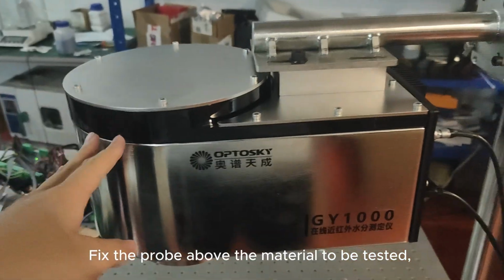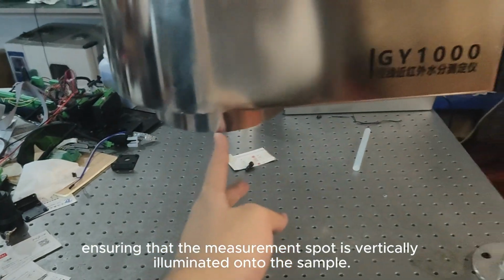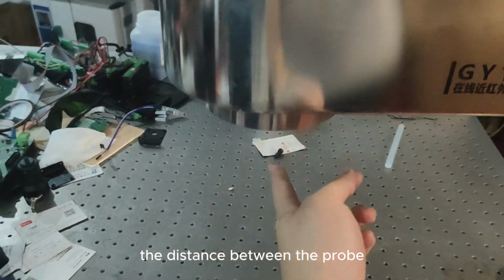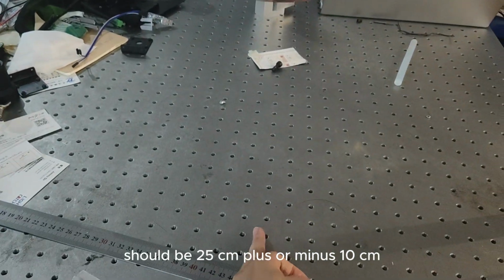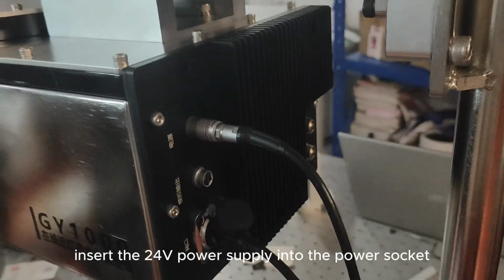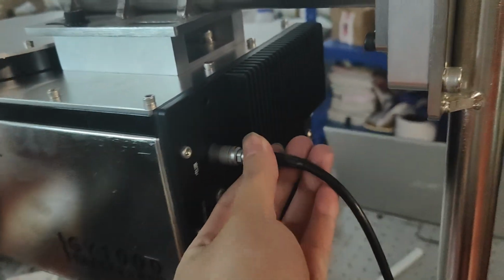Fix the probe above the material to be tested, ensuring that the measurement spot is vertically illuminated onto the sample. The distance between the probe window and the material to be tested should be 25 cm plus or minus 10 cm. Insert the 24V power supply into the power socket at the rear. Connect the network port to the PC.